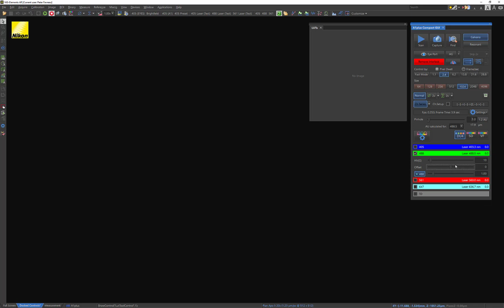So the key to finding the right settings is to limit your laser exposure when possible while trying to detect enough photons to reach roughly half the dynamic range of the detectors. And that's going to be indicated here in your lookup table. So let's go ahead and get started. I got some modest settings here so I don't initially start blasting my sample. And let's just see what we get. I'm going to hit the live button.